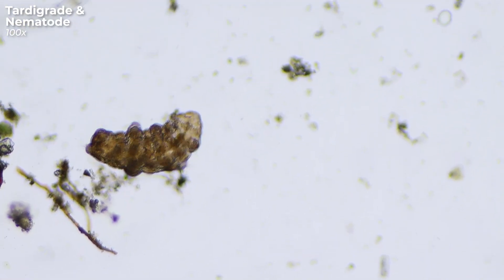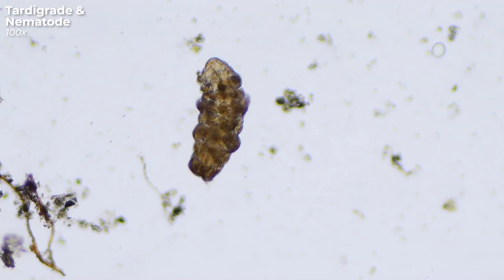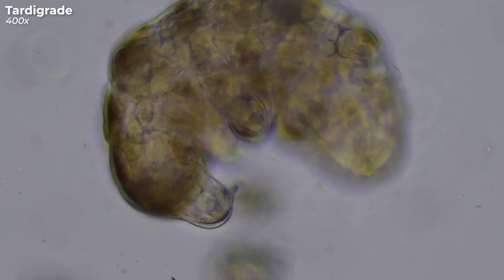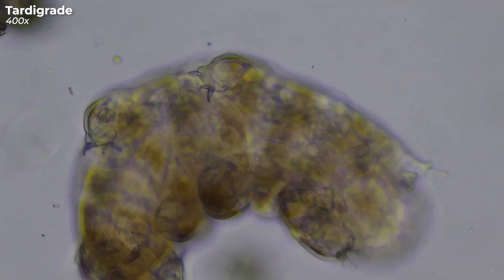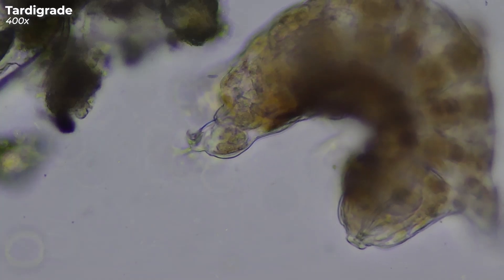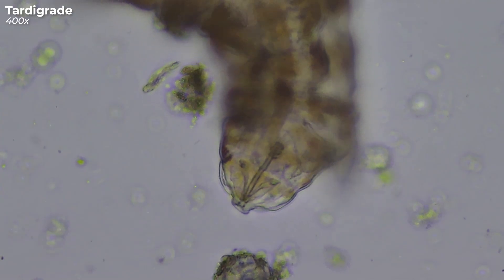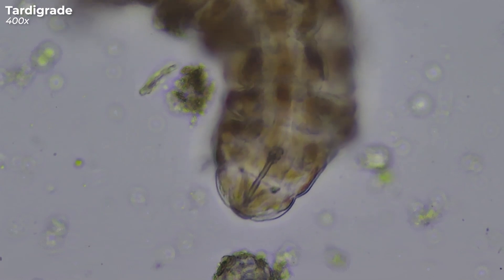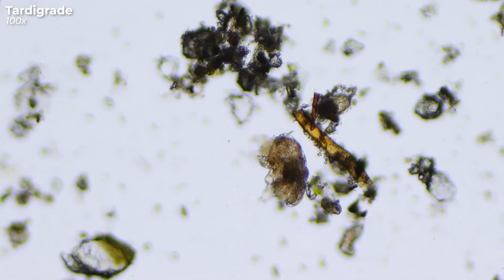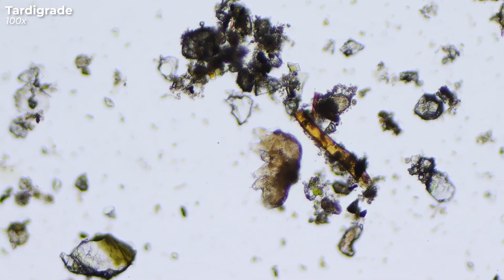Here our clumsy bear is roughly jostled by a very impetuous nematode — how rude! On their stubby legs are claws that help them cling to plant matter. Water bears do not have teeth. Instead, their tubular mouth opening is armed with spear-like structures. This allows them to pierce their food and then suck it out. And they are not really picky — they eat algae, plant cells, but also other invertebrates, for example nematodes, like the rude one from earlier.